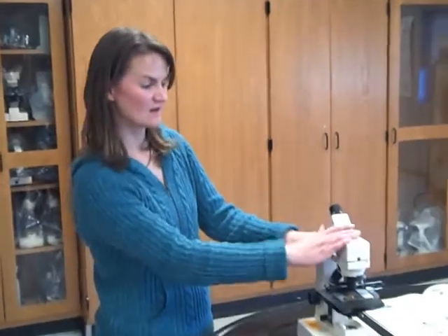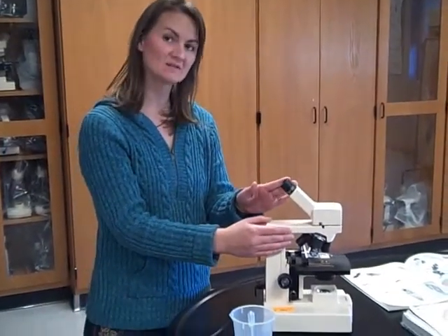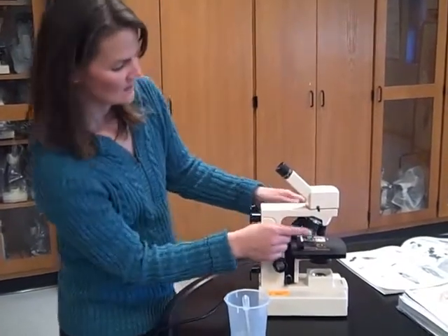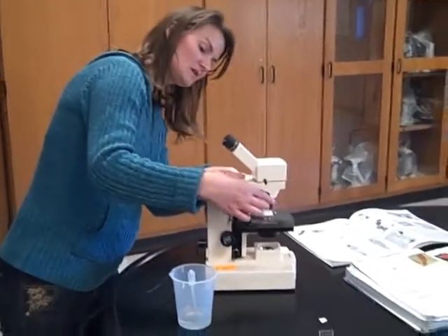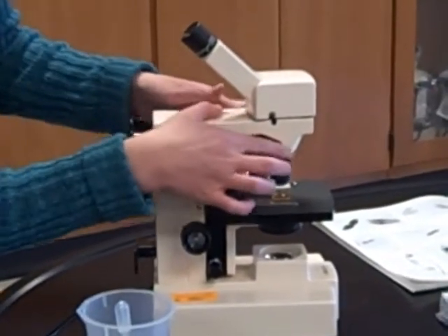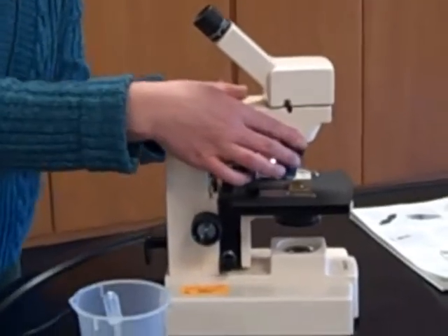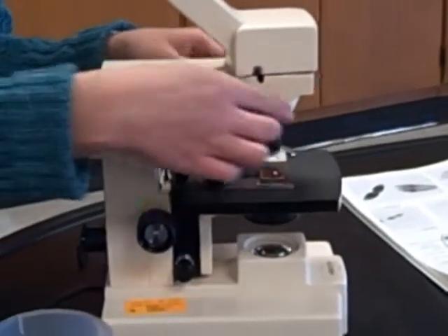You may have already heard about some basic parts of your microscope. Here's your eyepiece — it magnifies your object ten times. You have the body too. These are the objectives. Notice you can change the objectives by using the revolving nose piece here. You always want to hold on to this instead of the objectives when you change them. It will rattle them loose if you hold on to the actual objective.